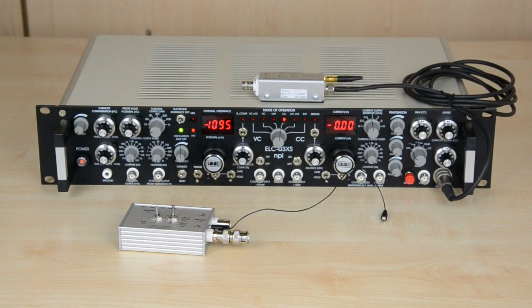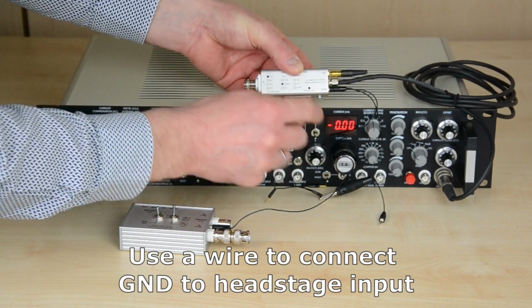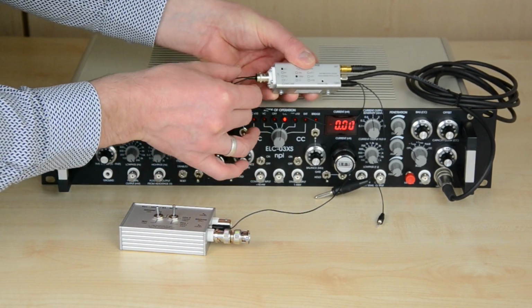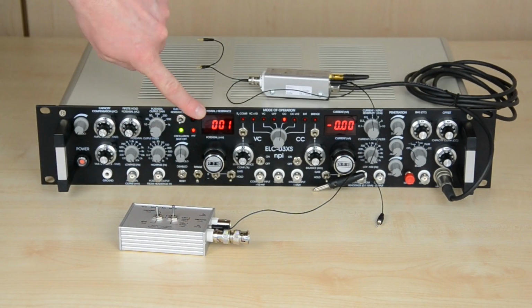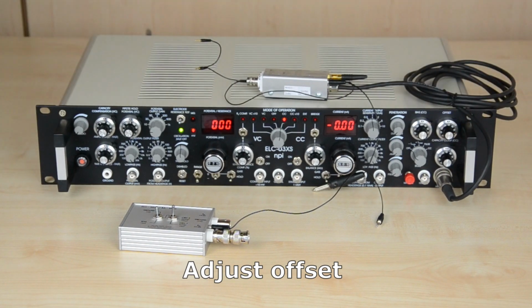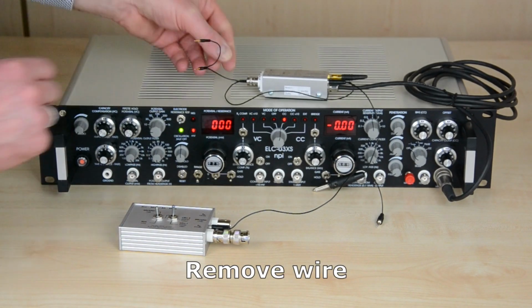Adjusting the bias current is only necessary every couple of months. For best results, we recommend using a wire to connect the head stage ground to the middle pin of the input BNC connector. Adjust any offsets as shown before. Then, remove the wire and connect the model cell.